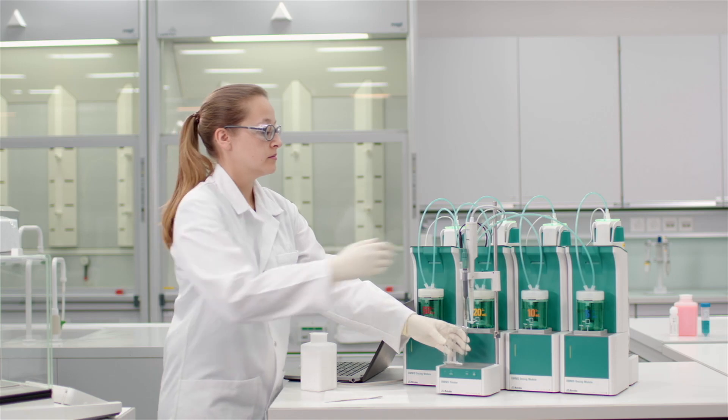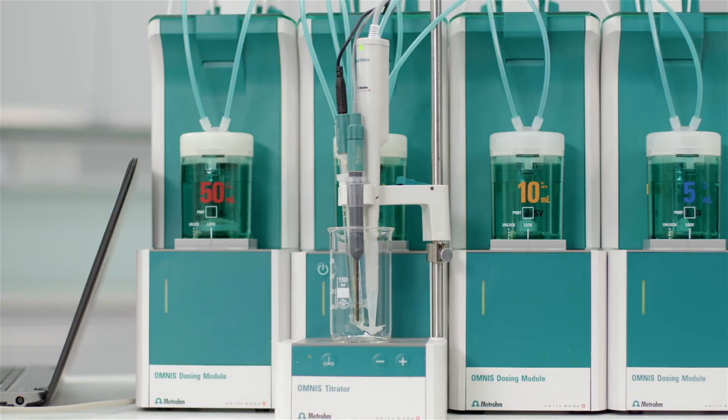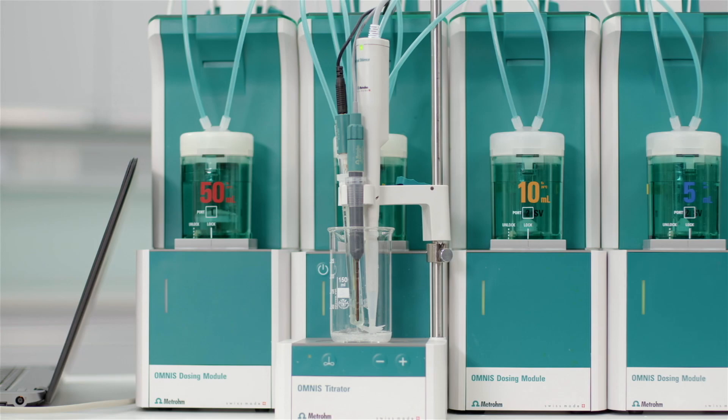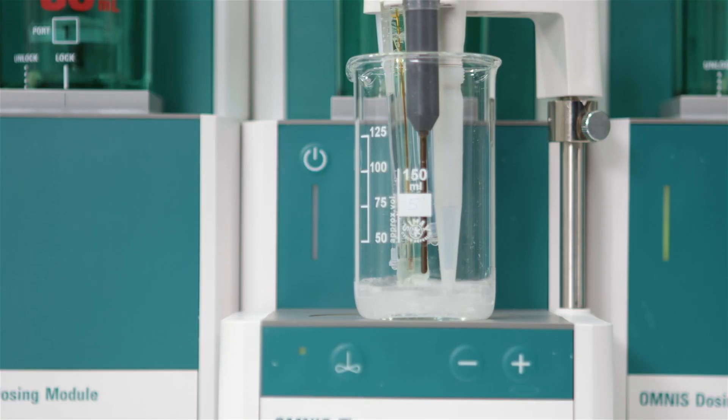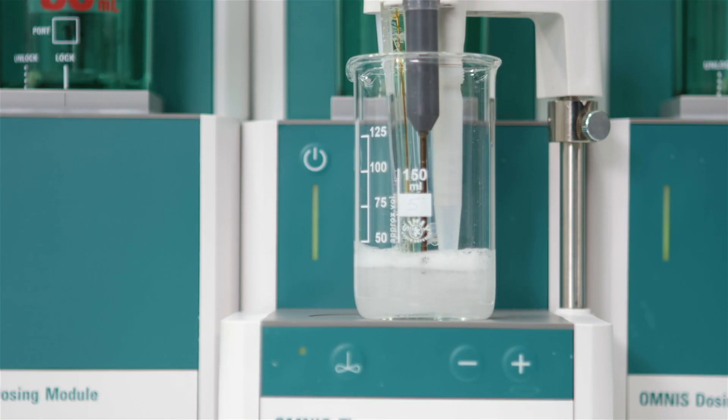With this Omnis standalone system we automatically add all reagents such as water, barium chloride, the buffer solution and of course also the titrant.